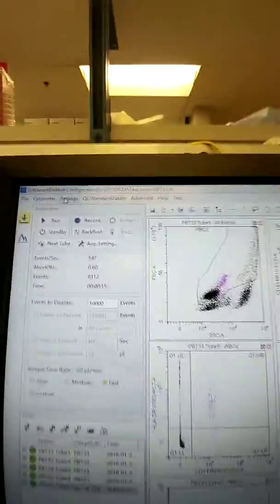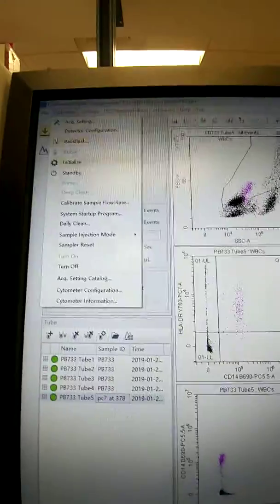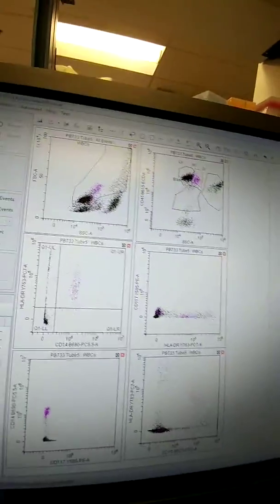So we can close that out. Now you can come up here, let's see, cytometer, and then acquisition setting catalog. Oops, let's make that bigger. And so there's our new acquisition gains that we just saved. Okay, so now we can close that.